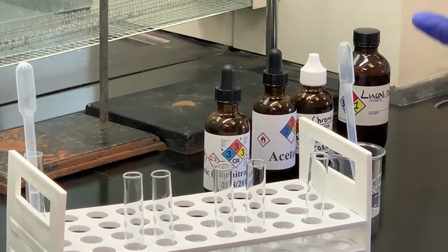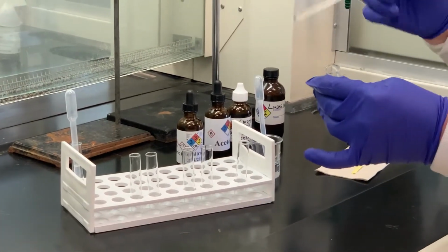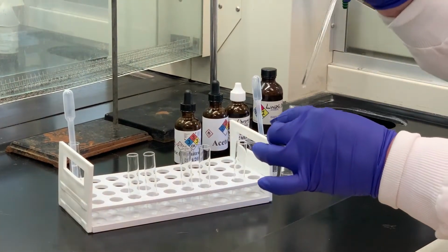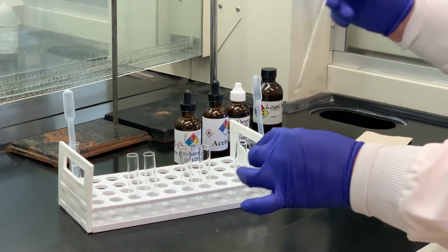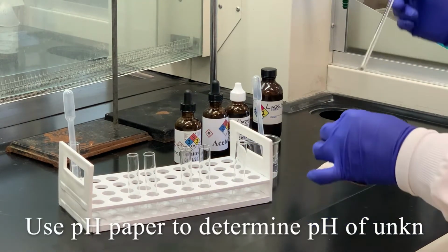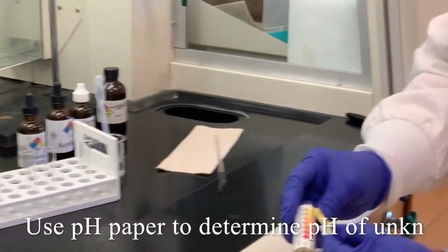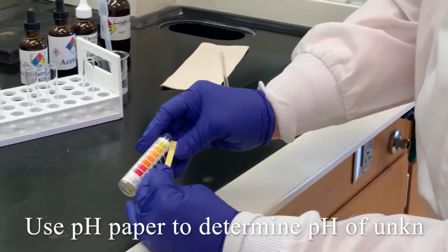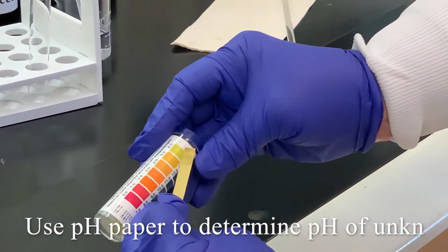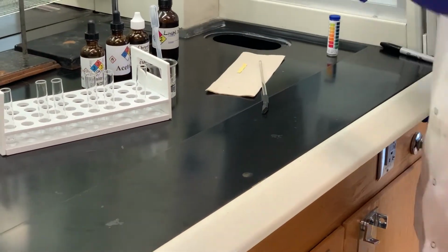And since it is soluble in water, remember from our flow chart, what I want to do is test the pH of that solution. So I'm going to take a drop and put it on my pH strip here. And as you can see, it's looking more like around pH of 6. So I'm just going to put that back to you.